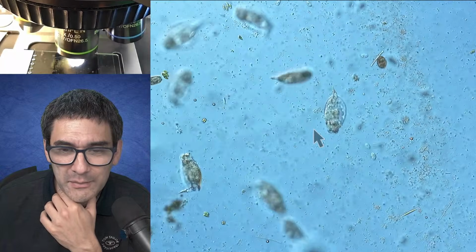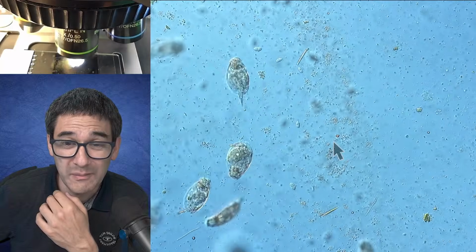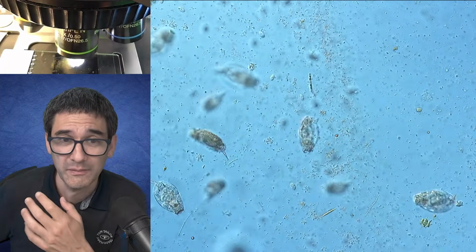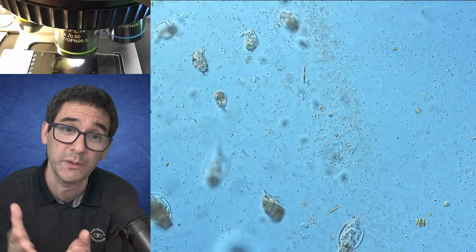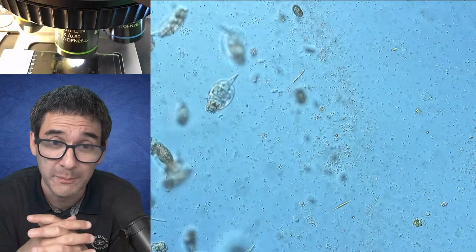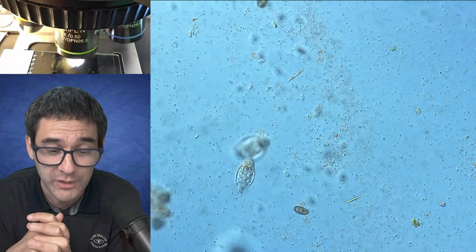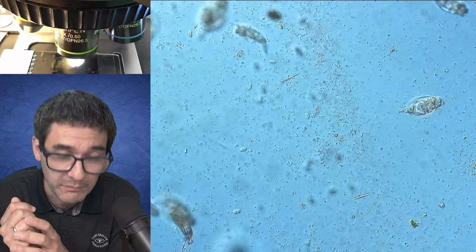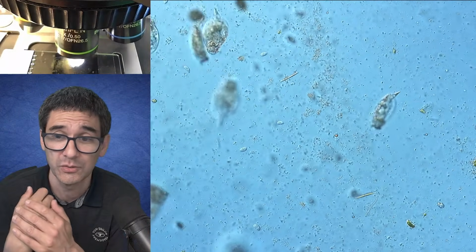But at the same time, I do have to tell you, while the bacterial concentration is pretty high, those bacteria are from the water, right? So it would be something different than if you were to grow bacteria that you've isolated from a human body or from animals. But still, you don't know which bacteria they are, so you have to stick to basic hygiene. I'll be rinsing everything properly later on, but the bacterial concentration is fairly high, so just be aware of that.